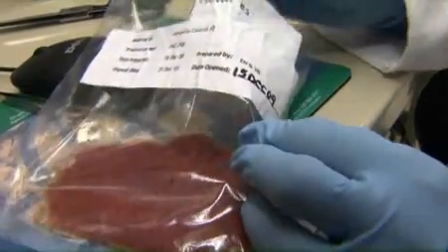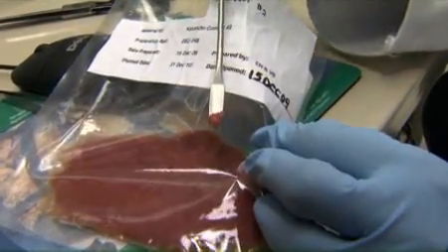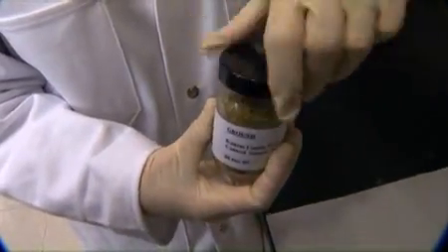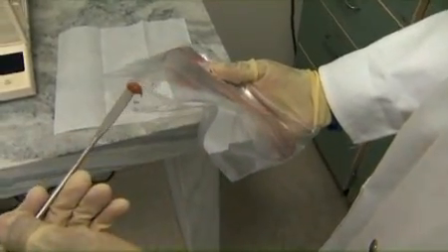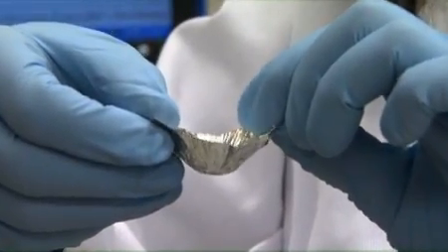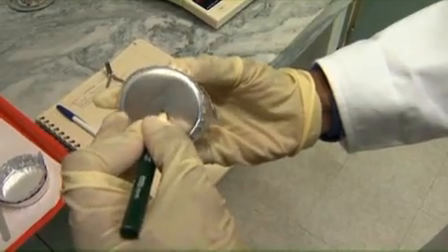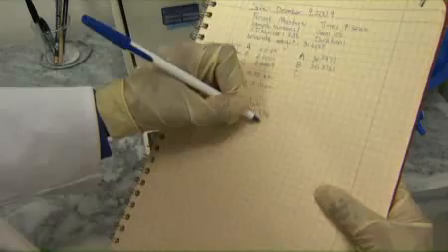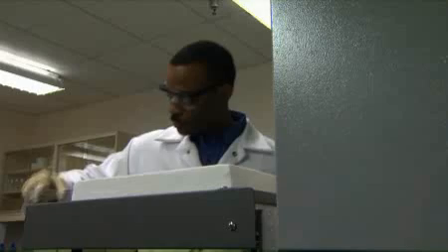Some of the recommended guidelines for good laboratory practices include: take measures to maintain the integrity of the samples throughout the process by limiting exposure to air and non-suitable storage temperatures, wearing gloves when handling samples and items associated with the test to prevent cross-contamination. Oil, moisture, or any other material on bare hands can affect the sample integrity, thus resulting in inaccurate data. Keep samples clearly labeled from preparation to disposal. Record observations at the time they are made. Exercise safety precautions at all times by using the specific safety supplies listed in the method.